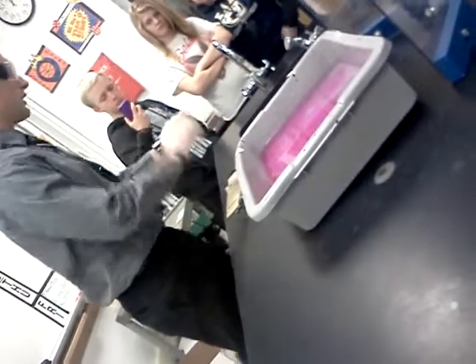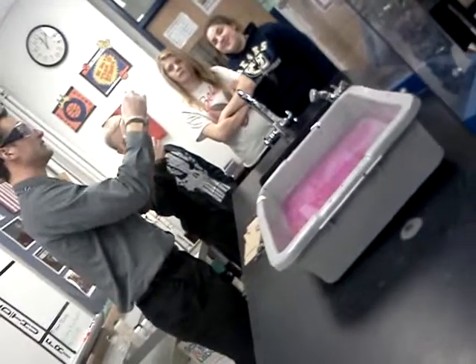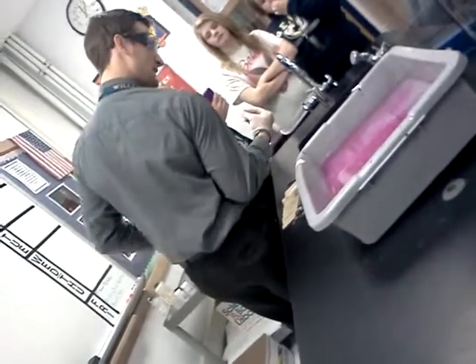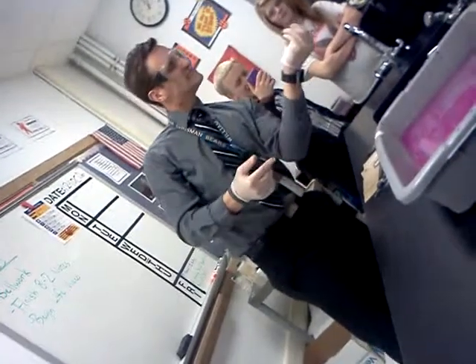It's a silvery color inside. Looks kind of like Play-Doh, but it's not. This is a metal. Watch when I do this. You ready? Let me show you the arms when I do this. Are you impressed? No. There we go. Look at that. Muscle. That's what it takes.